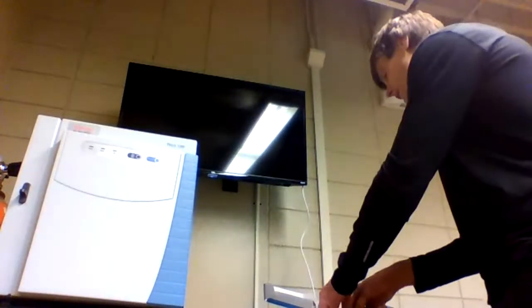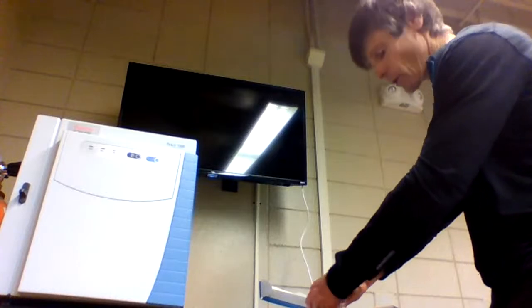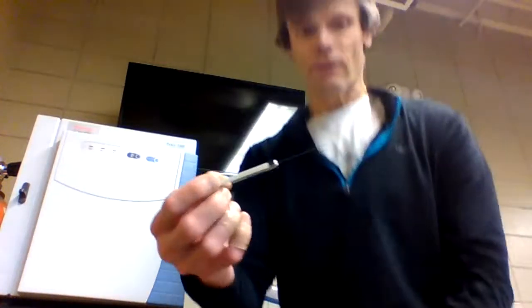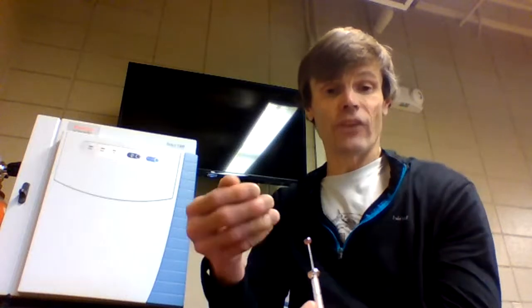Okay, this is the instrument itself right here. It's housed in here. Now, the sample that we're going to be introducing is typically in the form of a liquid. The liquid that we introduce is normally going to be from a syringe, just like this, a glass syringe that we would carefully aspirate or suck in some of our liquid sample. And remember, the sample is going to be volatile and thermally stable.